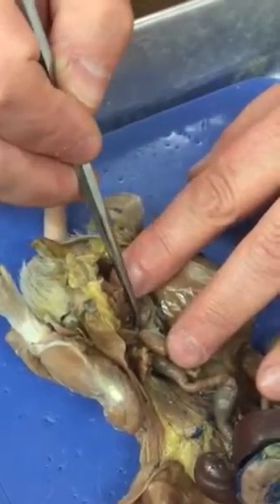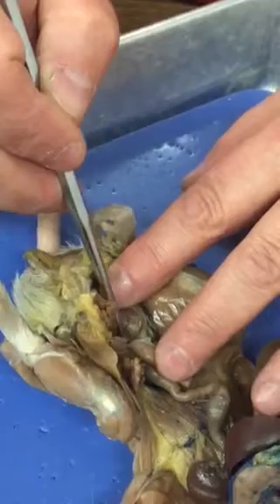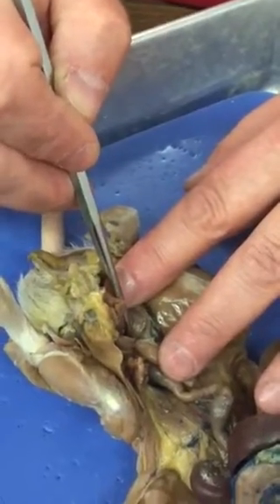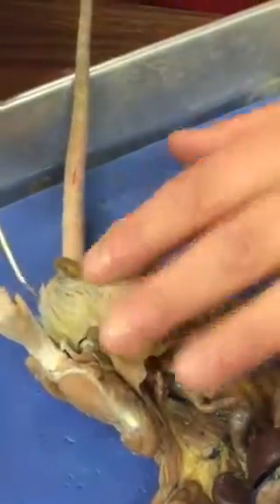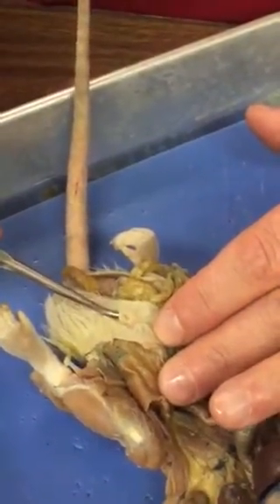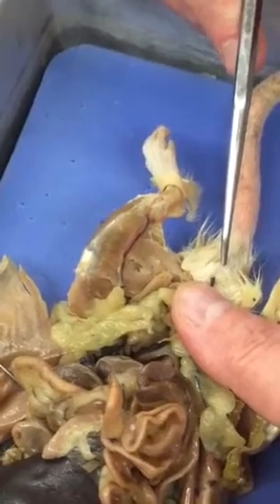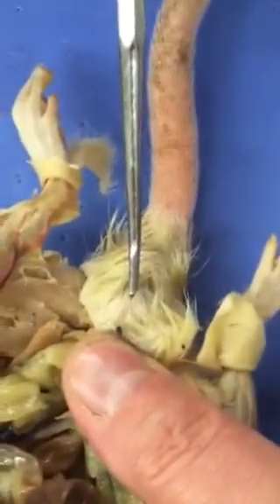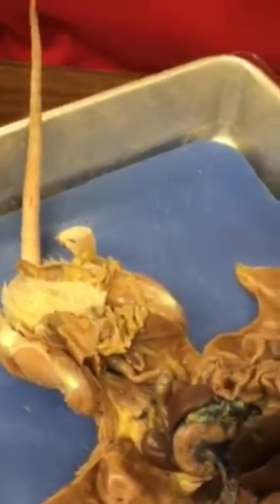So on the test, if there's a pin all the way down at the base of the bladder and a card says duct that exits the body, then you say urethra. Urine will exit the body in a male through the penis, and this is the head of the penis, in a female through the urinary opening. Right there. Now you're responsible for reproductive organs regardless of whether or not you have a male or a female.